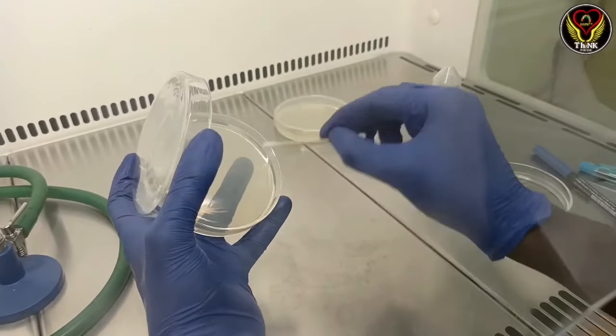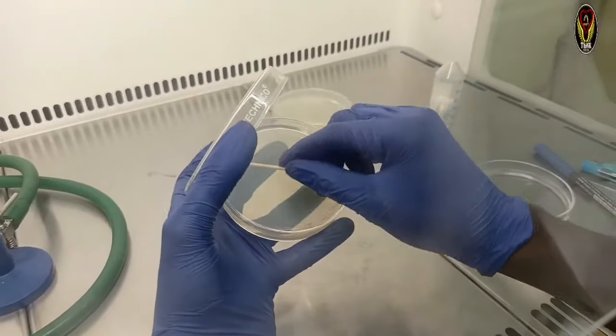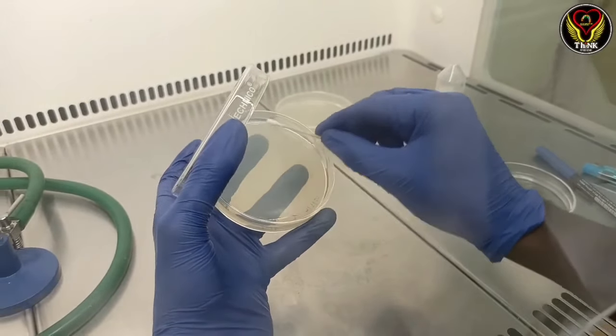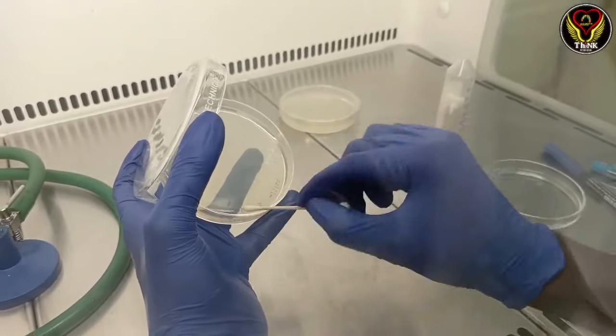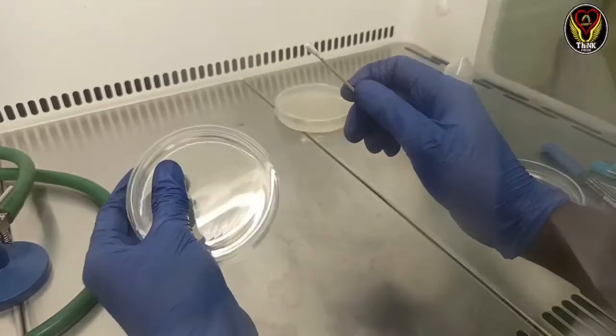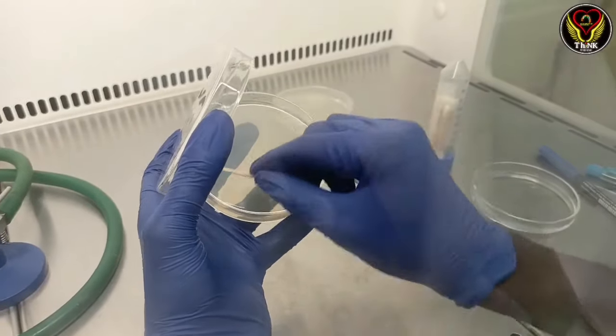Now we will swab to the left. When we swab in the 4 directions, we will swab to the left first. The bacteria distribution will be different.